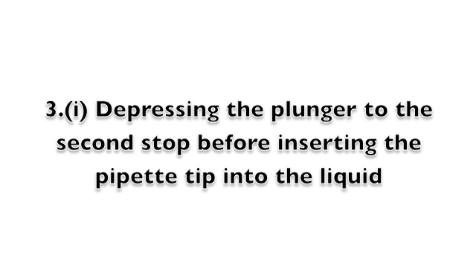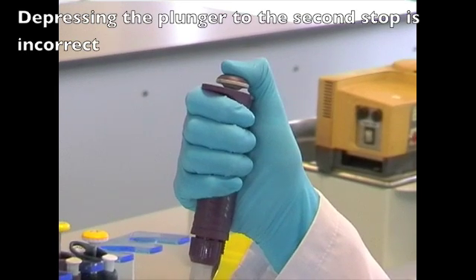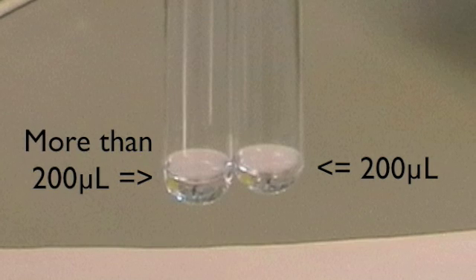Depressing the plunger to the second stop before inserting the pipette tip into the liquid is incorrect and will result in an excess amount of liquid, as shown here.